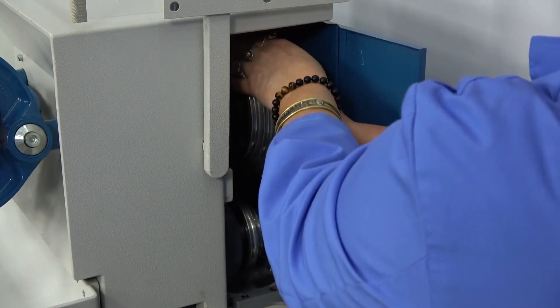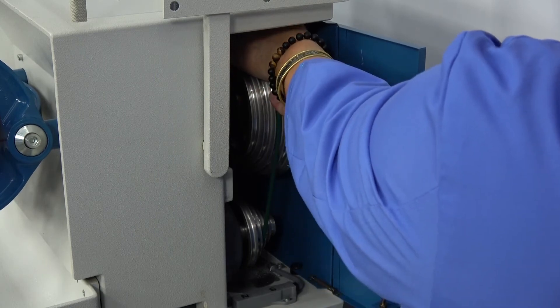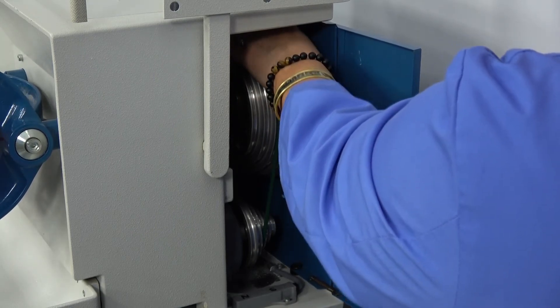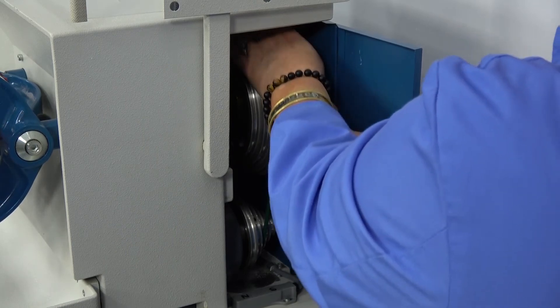Never open this door while it's moving. All of these units should be equipped with a safety latch to make sure that that does not happen.